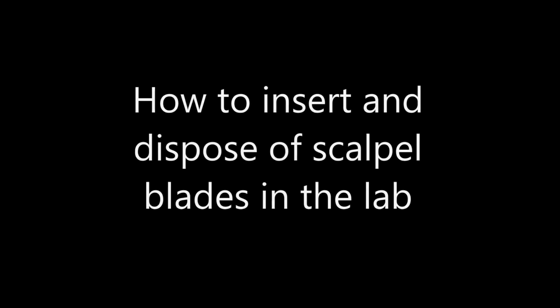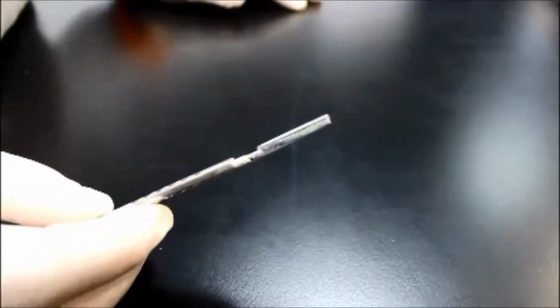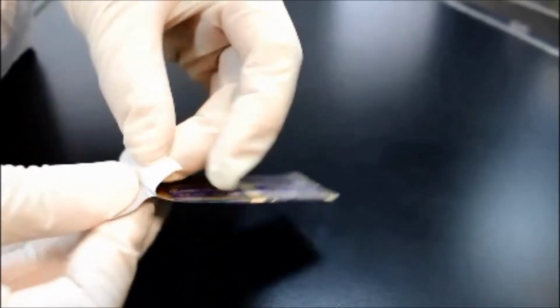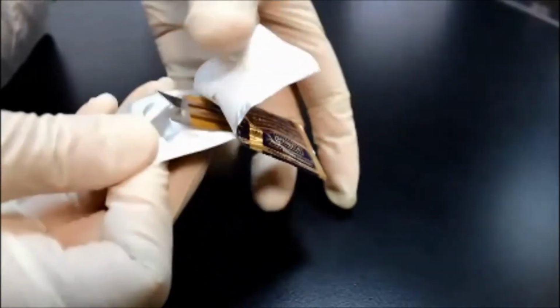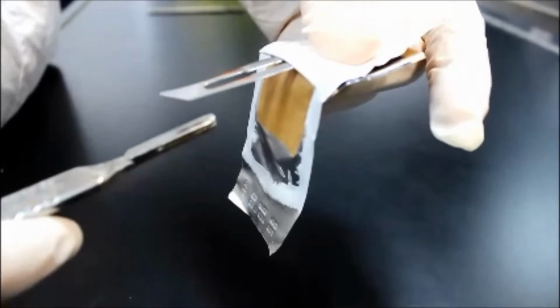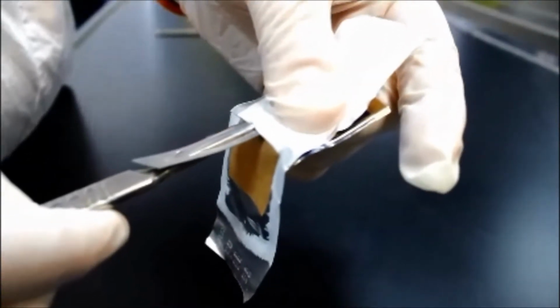How to insert and dispose of scalpel blades in the lab. Here you can see the groove in which you will insert the blade. It is very important to open the blade aseptically, as shown. Align the blade with the sloping edge on the holder and ensure the blade slides into the grooves on either side of the tang.